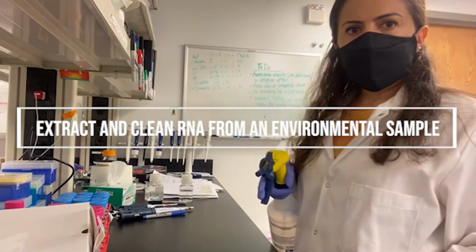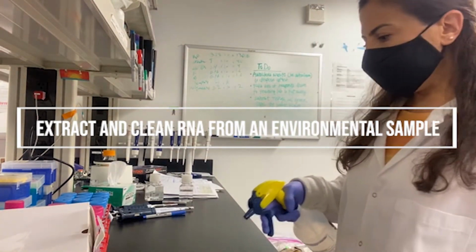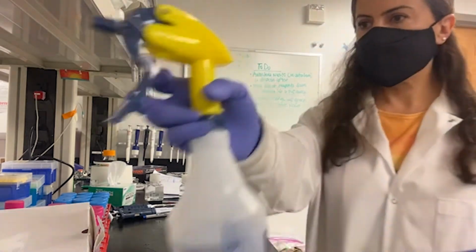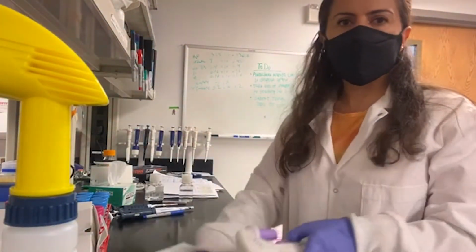Before I start my concentration, I would like to sterilize all my equipment and my bench so I don't contaminate my sample.